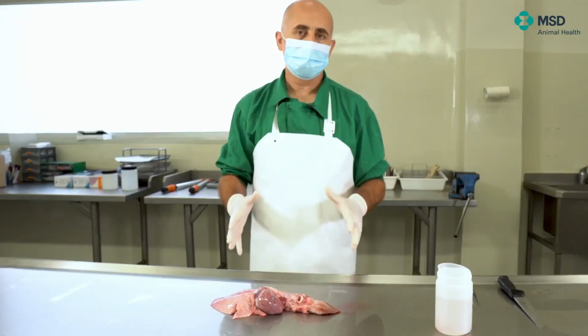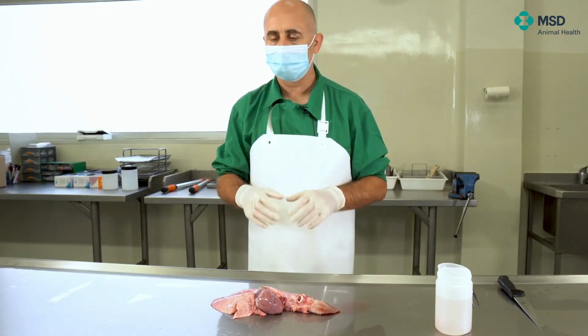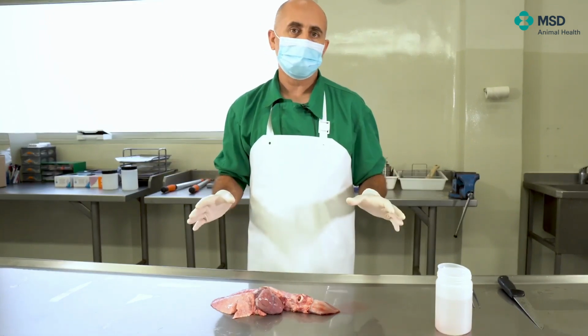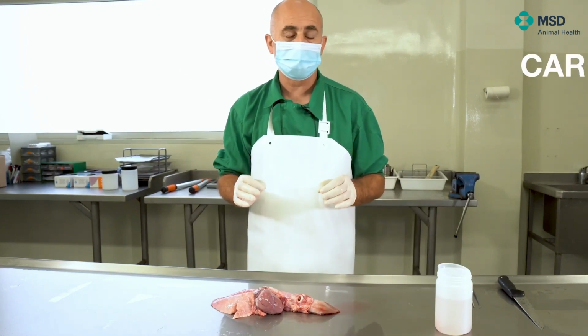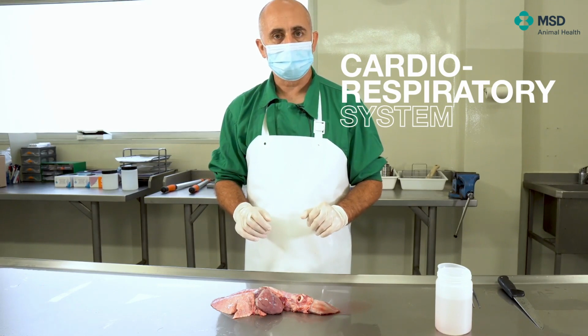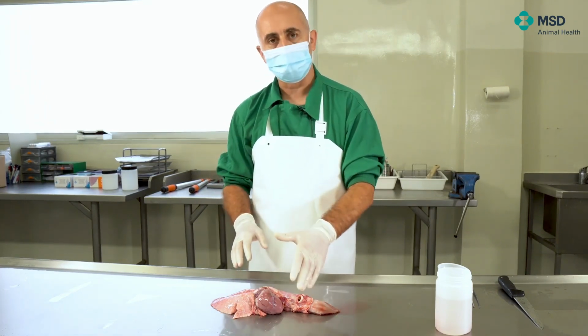So now it's time to go for each of the tracts or areas or tissues that are of interest. Of course, here we will follow them up, all of them, basically because this is a normal animal, but just to give the tips of what we should go for. Here we will start with the cardiorespiratory system. Our recommendation is never to separate the lungs from the heart.